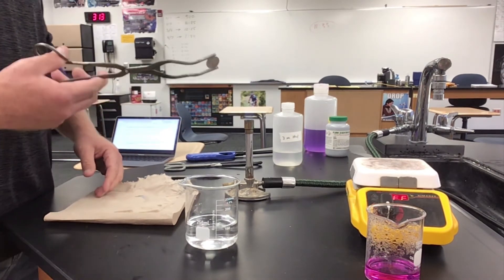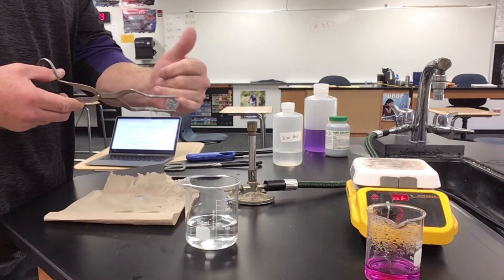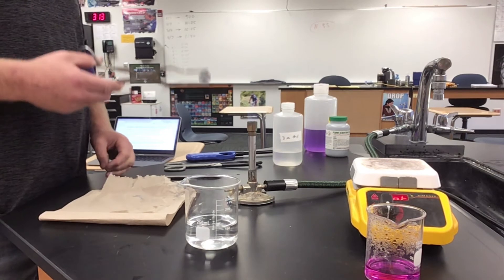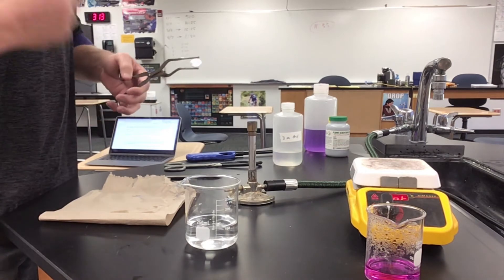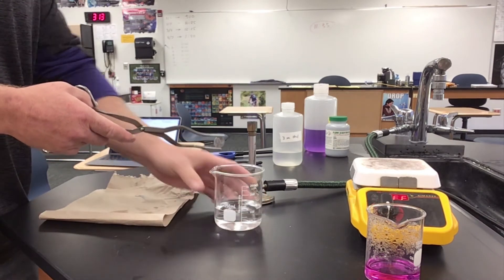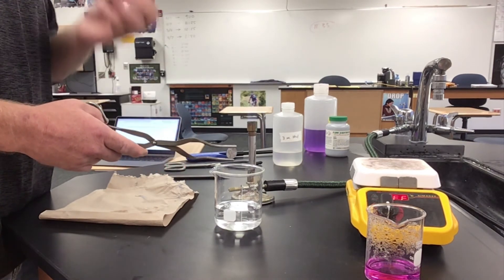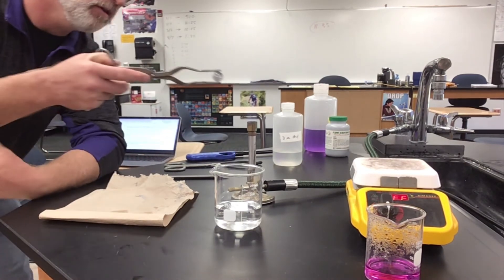Here's the trick — the timing has to be really spot on. I'm going to put the penny in the flame, holding it on the edges only so I don't create a dead spot or uneven heating on the face. I'm watching for that silver color to turn to a gold color. As soon as I see that, I'm going to drop it very quickly into my cold water. I want to go from the semi-molten stage on the surface where I'm creating the brass, and dropping it into cold water flashes or locks that brass production in place by going from hot to cold very quickly.